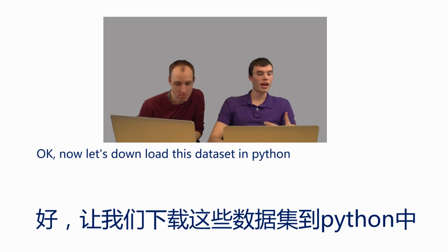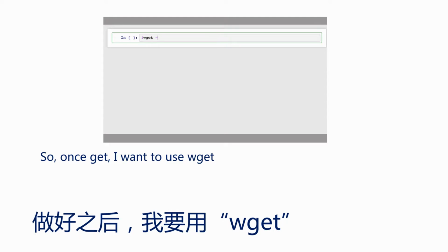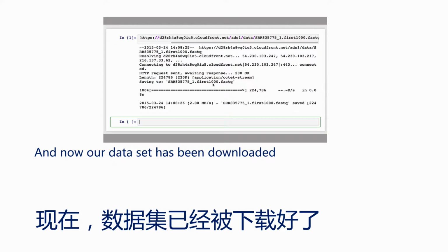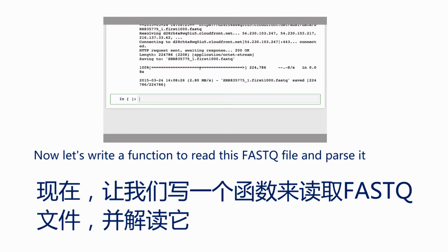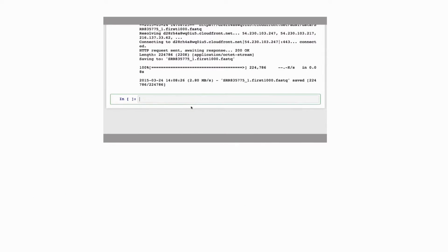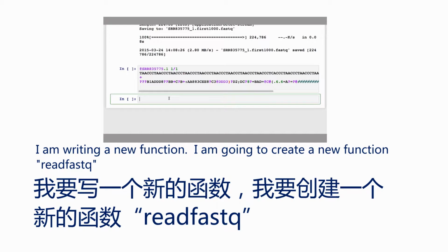Okay, now let's download this data set in Python. So once again, I'm going to use wget. I'm going to paste in the URL. And now our data set has been downloaded. Now let's write a function to read this FASTQ file and parse it. So I'm going to just copy over a set of lines here just to refer to when writing this function. So I'm going to create a new function, read_fastq.